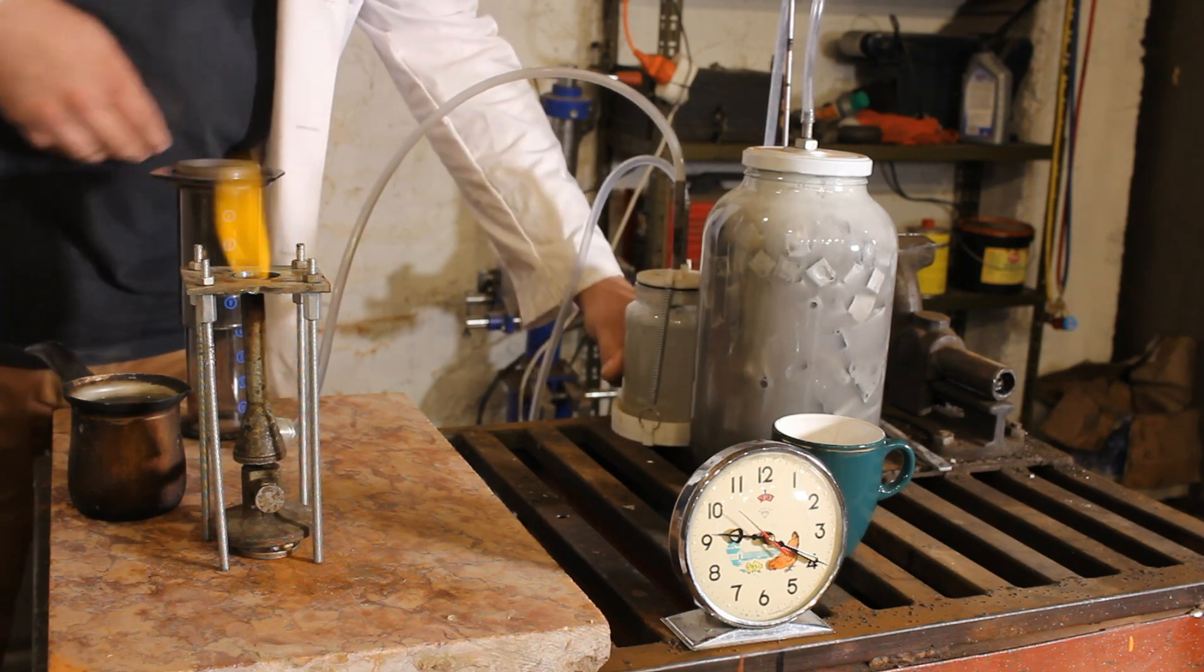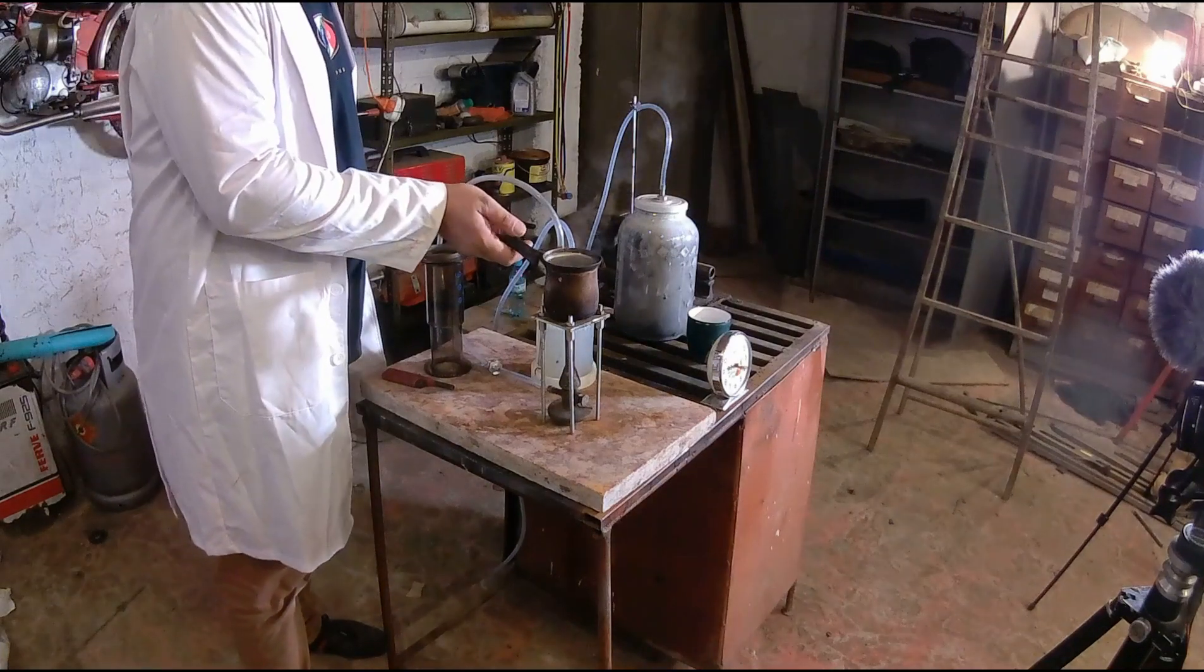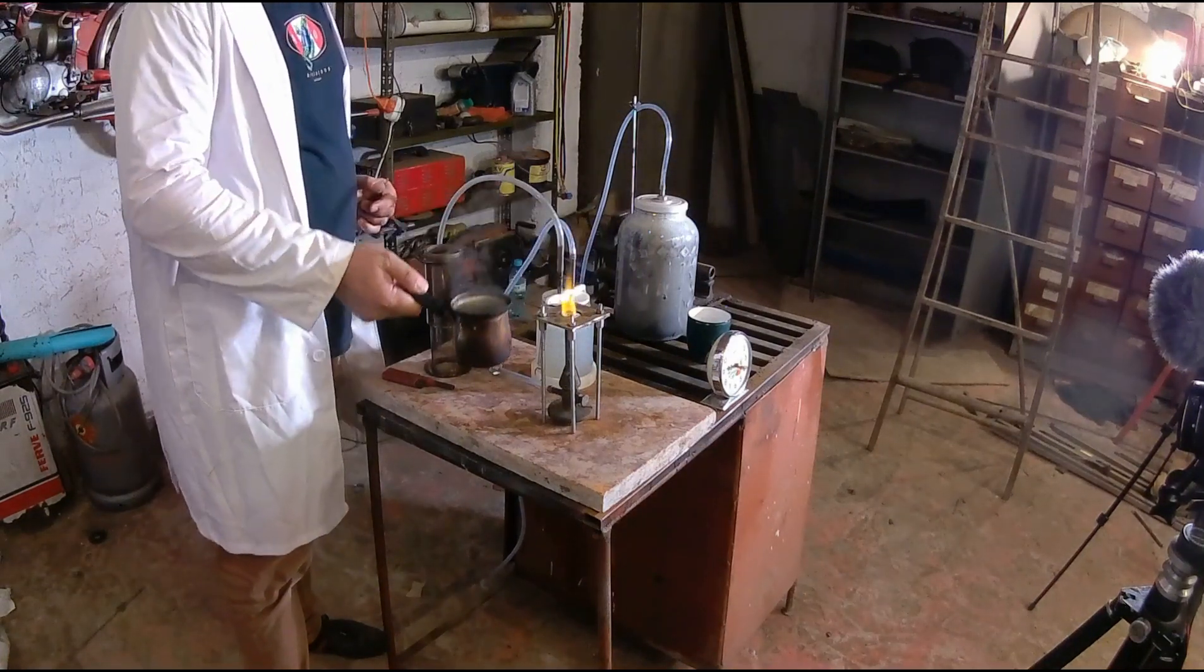I've decided to disconnect the bubbler and offer you a view from another angle. So this is the previous scene, as seen from my secondary camera.